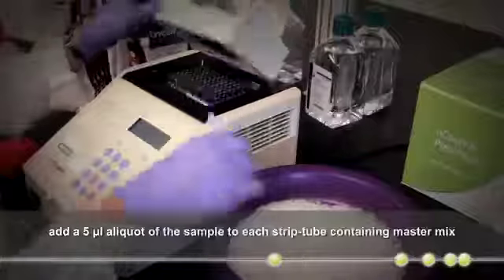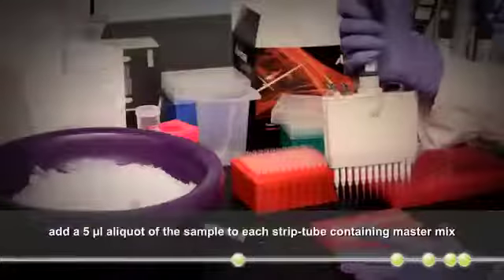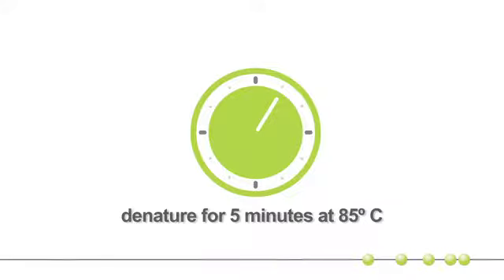Add a 5 microliters aliquot from the sample prepared according to the microRNA sample preparation protocol to each tube. Be sure to denature the samples for 5 minutes at 85C and then quick cool them on ice before adding them to the hybridization reaction.